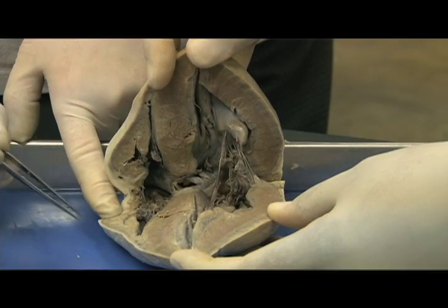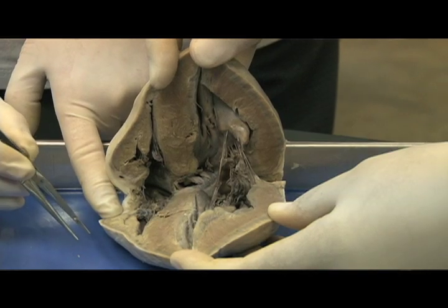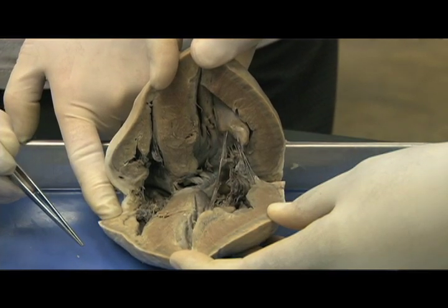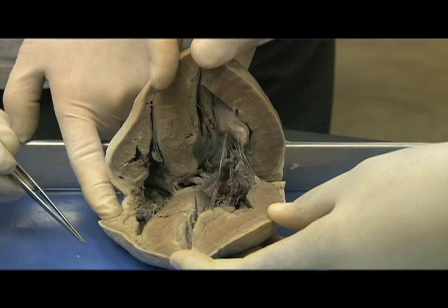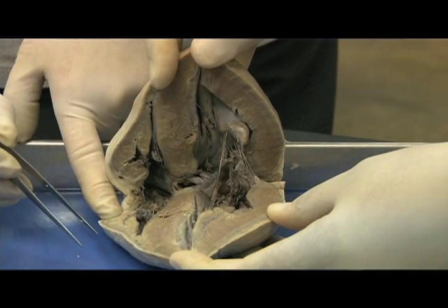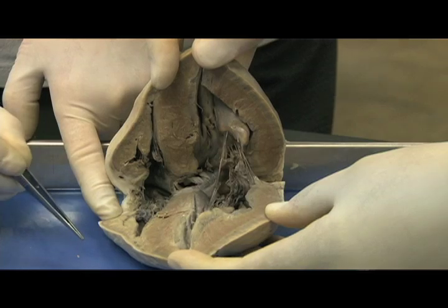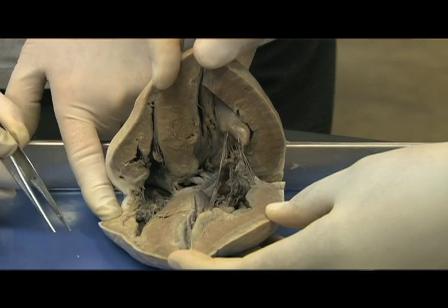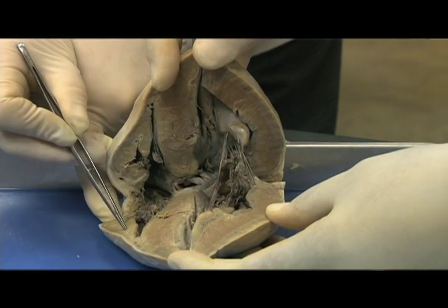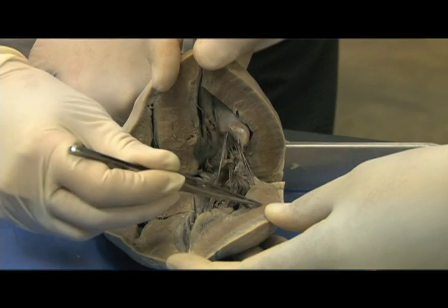This is a coronal section of the heart. When you dissect the heart in this manner you end up with two sections — one that is anterior and one that is posterior. In this section you need to observe the thickness of the outer heart wall to determine the right and the left ventricle.